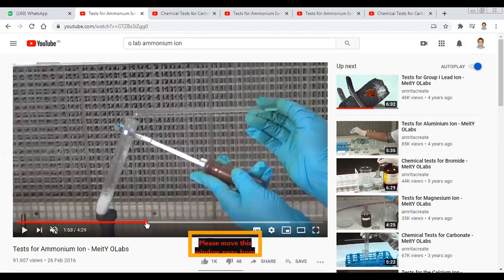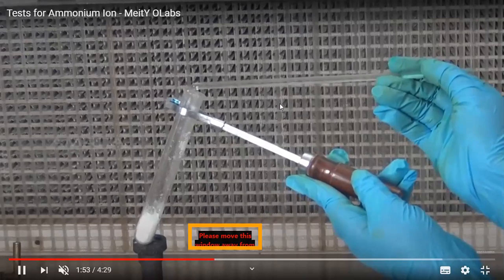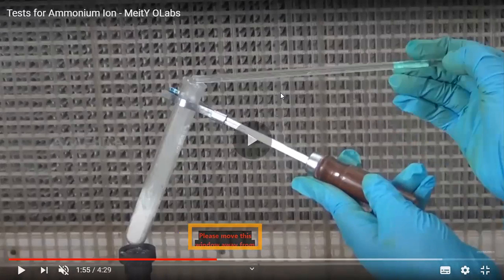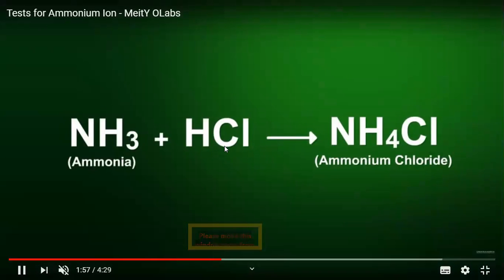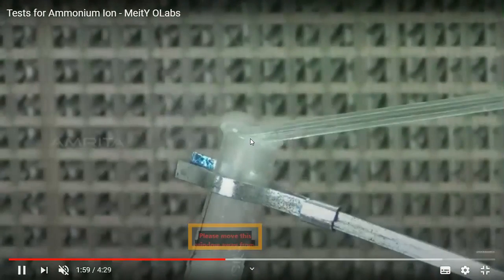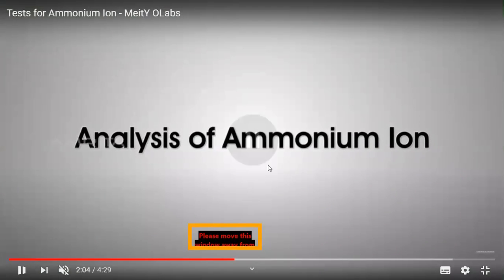Let me show you once again. Whenever we bring the glass rod, which is dipped into the hydrochloric acid, near the mouth of the test tube while heating the salt, let us see what happens. You can see the white fumes. These white fumes are produced because of the reaction of ammonia with hydrochloric acid, and NH4Cl is produced. You can see the white fumes again. These are the white fumes of ammonium chloride, and this is how we understand the presence of the ammonium ion.